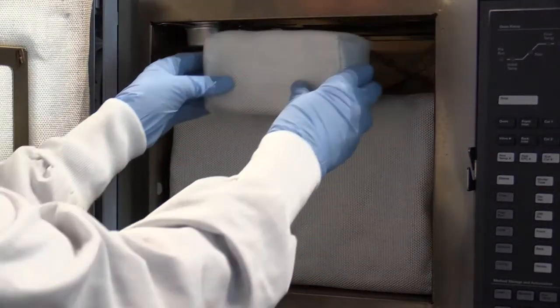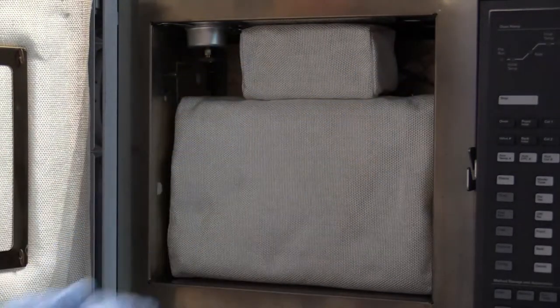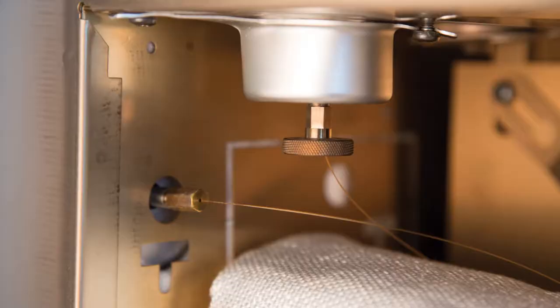If there is a detector in the front position, install the two block inserts as shown. Be careful that the block inserts do not touch the analytical column or the MSD source nut.